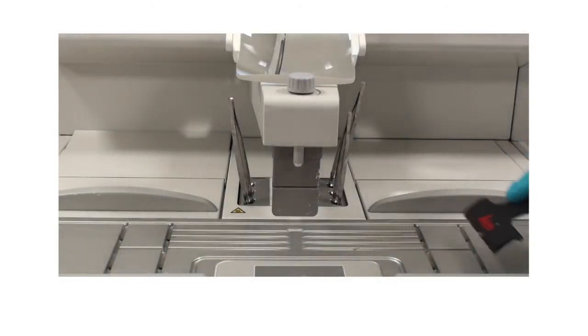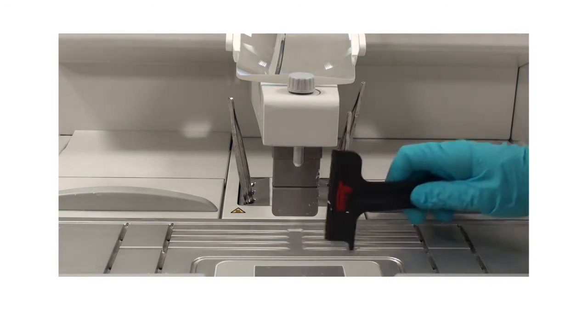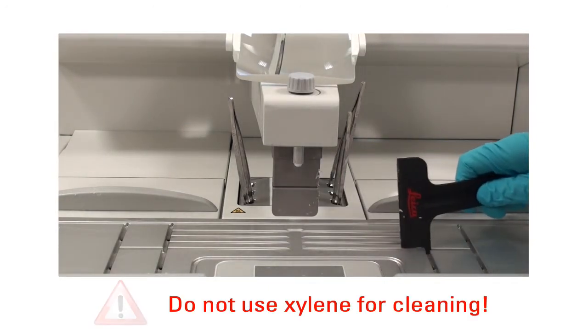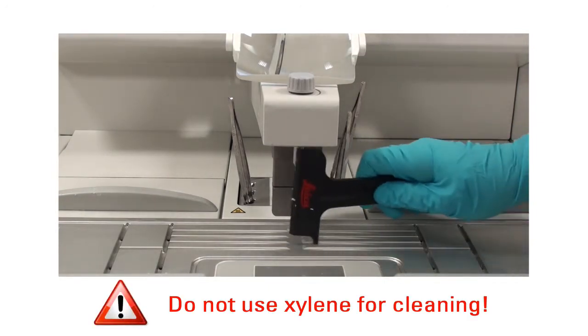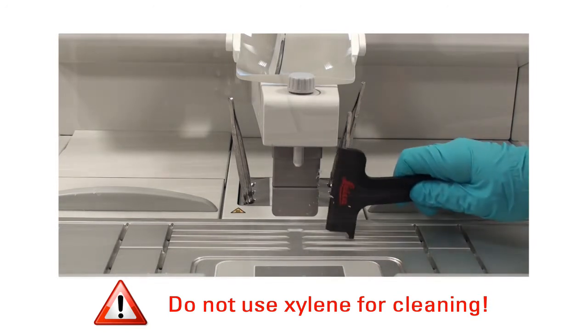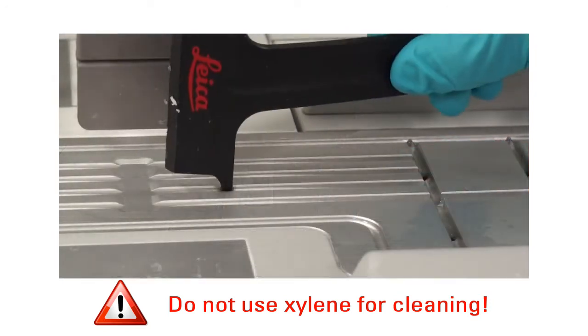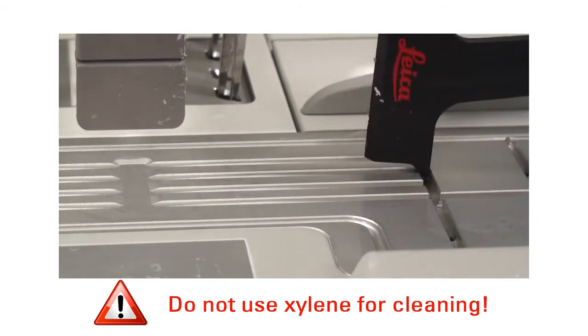All common laboratory cleaning products suitable for the removal of paraffin such as xylene substitutes and paraffin remover can be used to clean the work area. Use the specially designed paraffin scraper to properly clean the surface grooves.